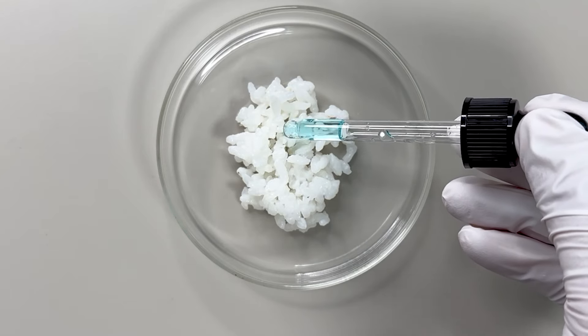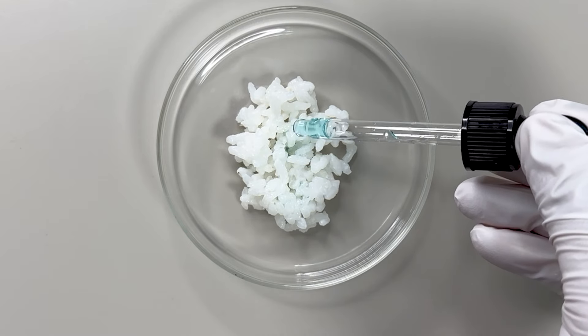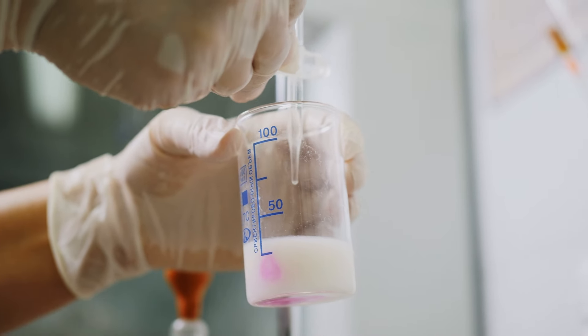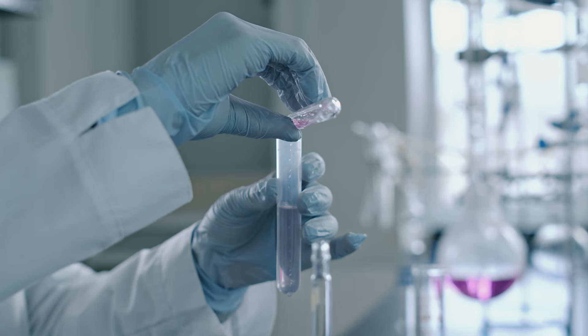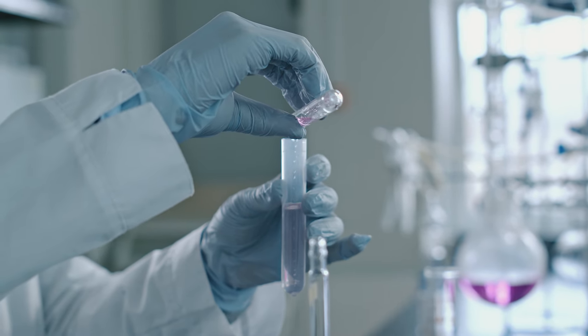We used a specific reagent to detect whether starch has been broken down. This reagent changes color when it comes into contact with certain nutrients, allowing us to identify the presence of these nutrients.